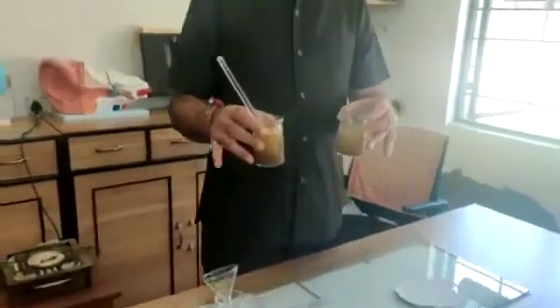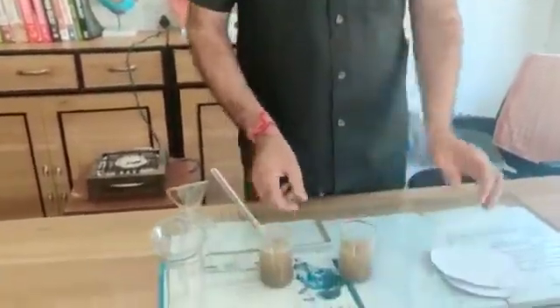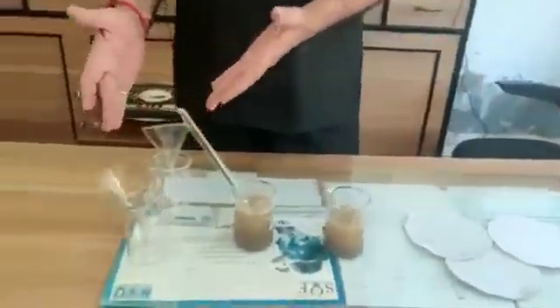Hello viewers, how are you? Today I am going to demonstrate the experiment of how to estimate the presence of particulate matter in different samples of soil. For that purpose we need two separate samples — Sample A and Sample B — taken from different water sources, from different ponds. We have filter papers, we have funnels.